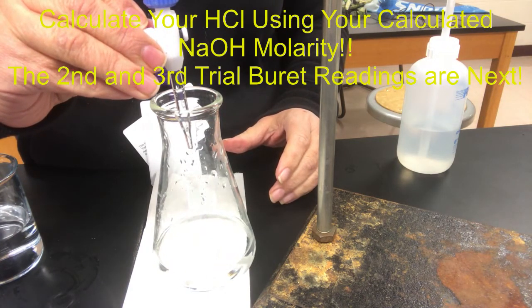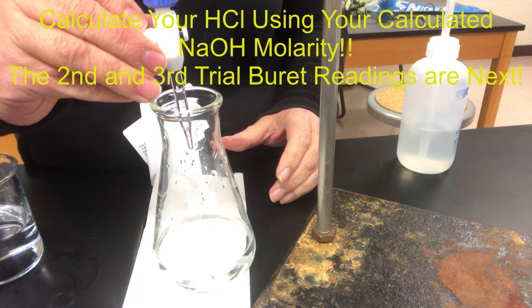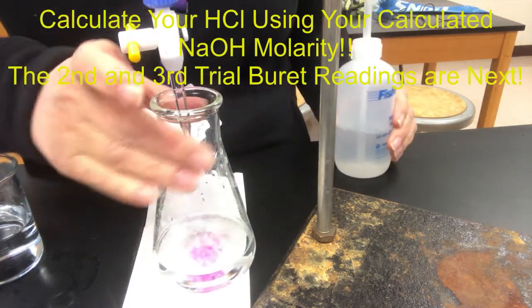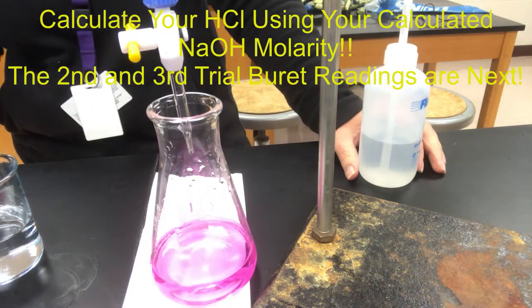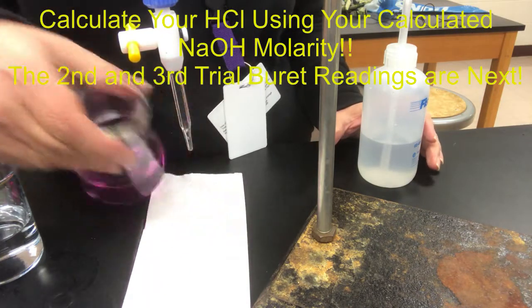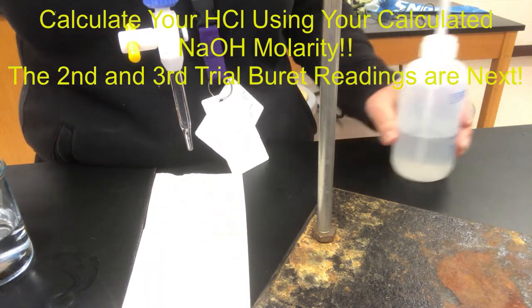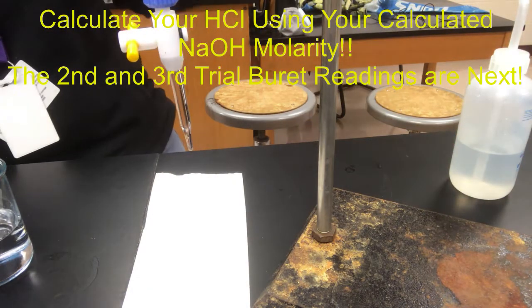So right now I got nothing. Come on. Okay, so that's a hanging drop. There it goes. Back it up. Oh yeah, so we were there, right? That's pretty dark. Wow. So that reading that I showed you stands. You won't have to adjust that at all. So from that you should be able to calculate, well, I'd be able to calculate the concentration of the hydrochloric acid from there.